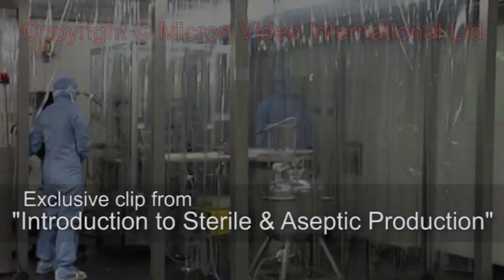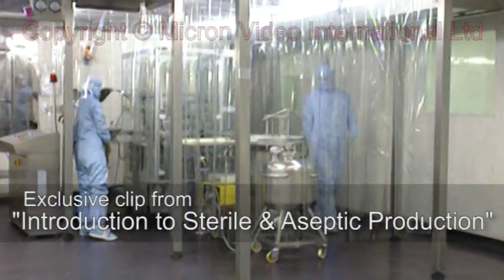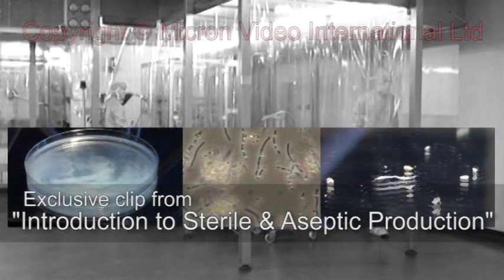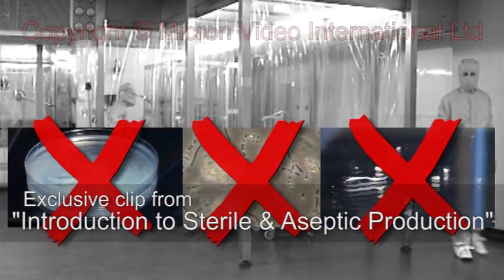Clean rooms are not just rooms that are especially clean. Through their design, construction and operation, they provide first-line protection from contaminants during manufacture.